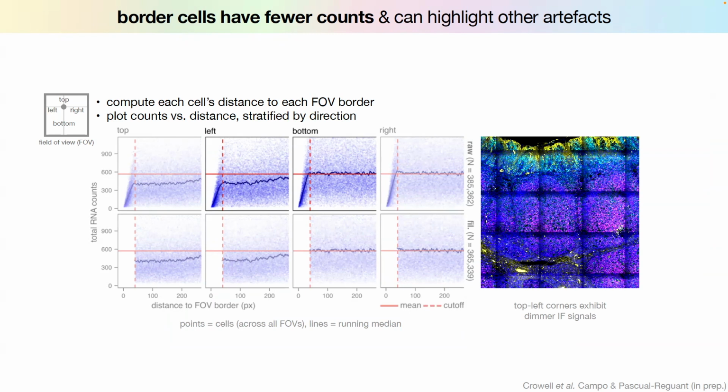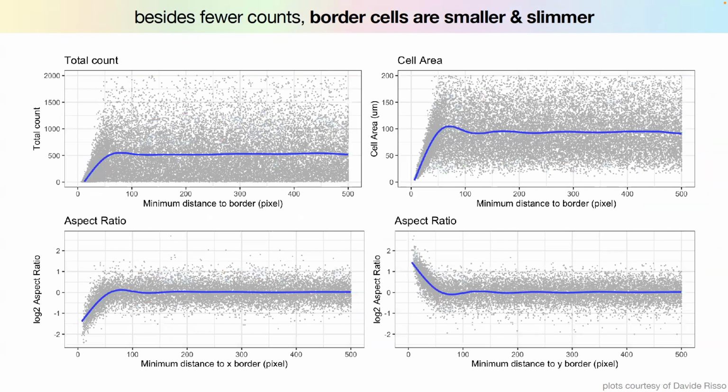All right. This is the same plots as before, but what is also shown here is the aspect ratio of the cell. Of course, if we're cutting the cell, then on average, in the distribution, we get slimmer cells, so they're thinner, and they have fewer counts. What this should teach us is that we don't want to just remove small cells, we don't want to remove low transcript cells, but we want to take a combination of all of these things as a criterion to deem a cell useless. Because just because it's small doesn't make it useless.